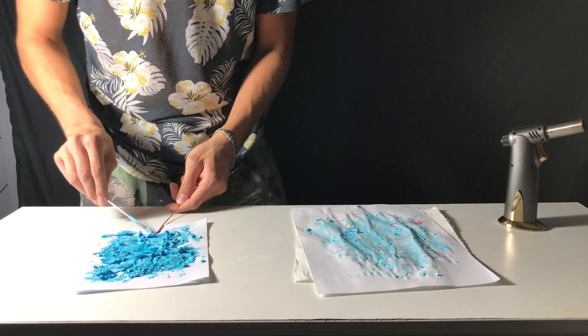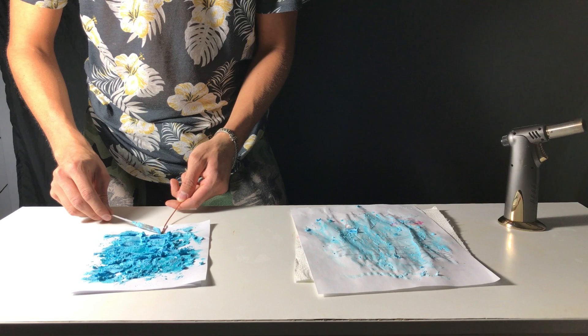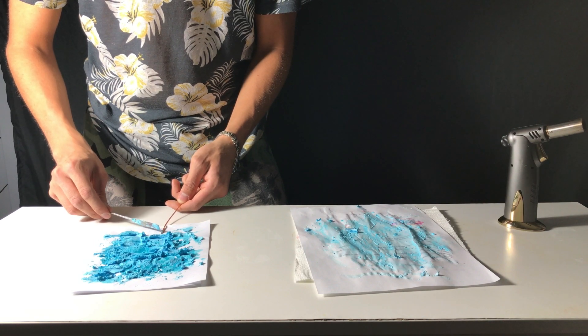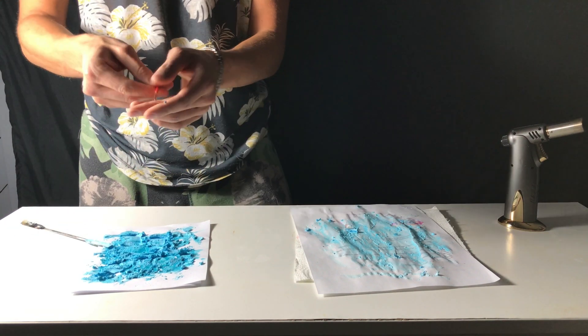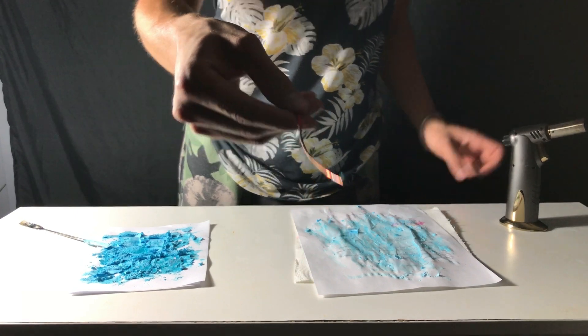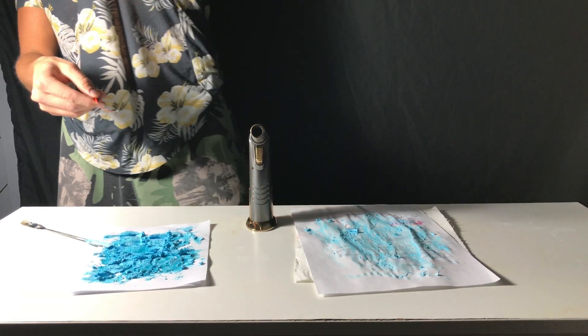After cleaning our spatula, we perform the flame test with our purified copper benzoate. You can see that the color is distinctively green. The green color signals the presence of copper.